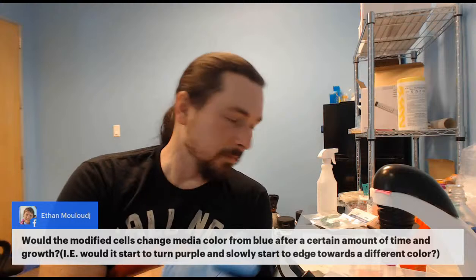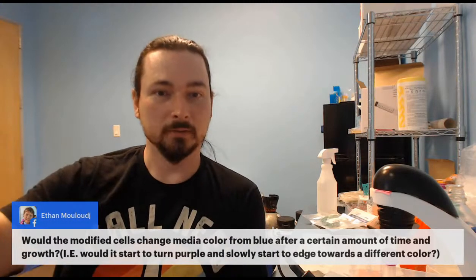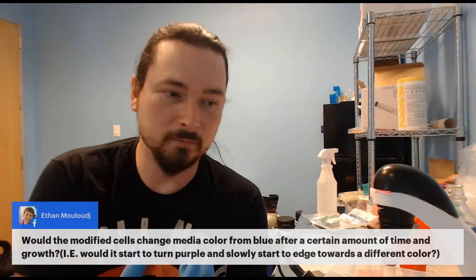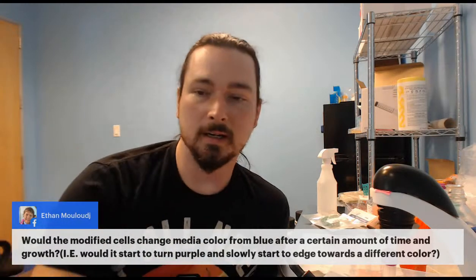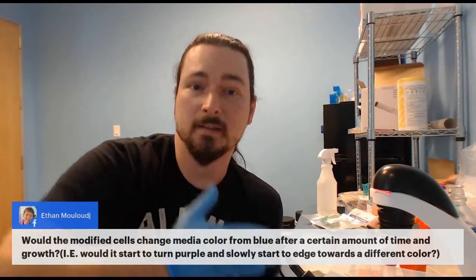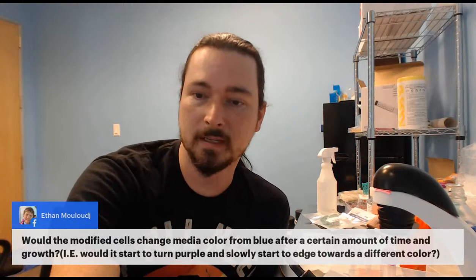Come back in a little while, it's vaguely purple. It gets purpler and purpler, and bluer and bluer, until it's a really rich blue. But it also depends on how much you use. If you use more XGAL, you get a faster, darker blue.